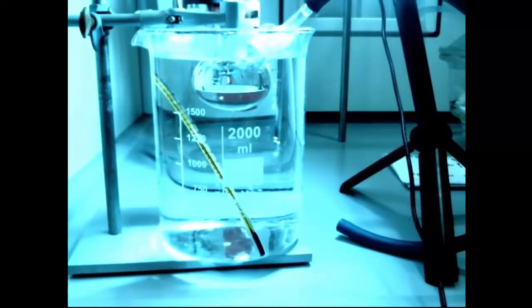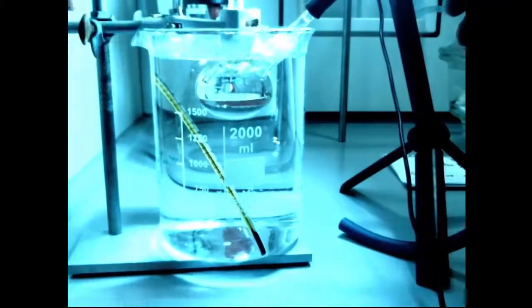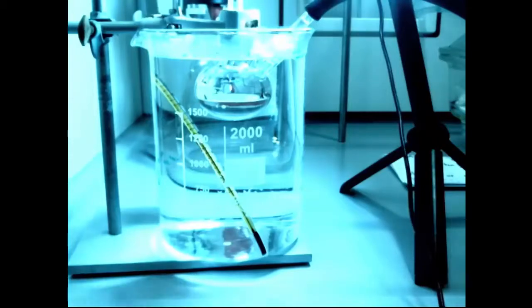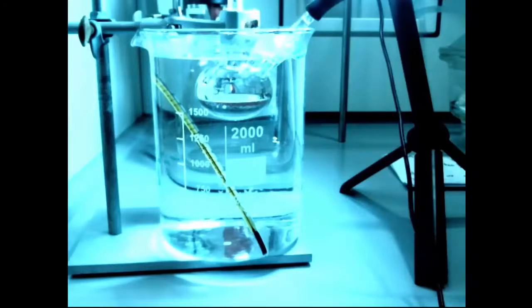So it's not boiling, obviously, at room temperature. Now we're pumping it and nothing is happening. Now I've opened the valve, closing all the things, making sure that everything's working, and pumping it. You can see a little bit of action, but nothing really exciting happens. And now it's been going for a fairly long time, so I'm going to let the air back in again. You can see when I let the air in, it blows back in.